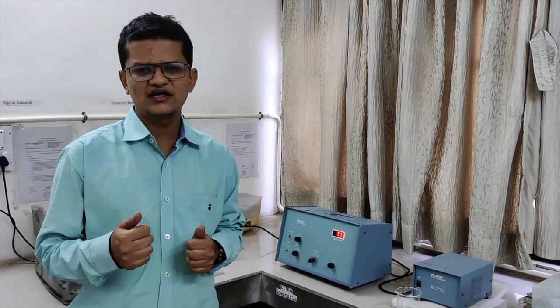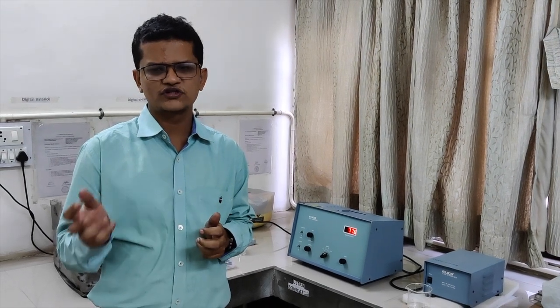As you can see, two filters are used in the case of the fluorimeter. The primary filter generally filters the UV light and is used for the excitation wavelength, while the secondary filter is used to filter the emitted wavelength, while the detector measures the emitted wavelength.